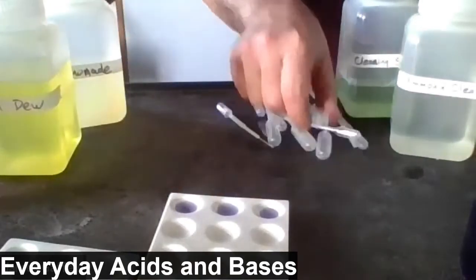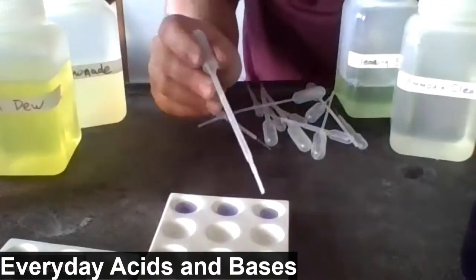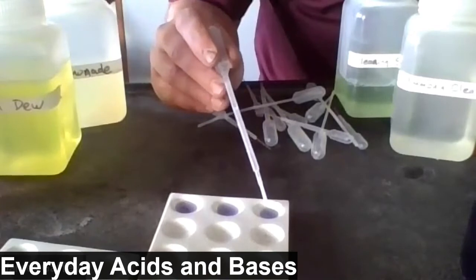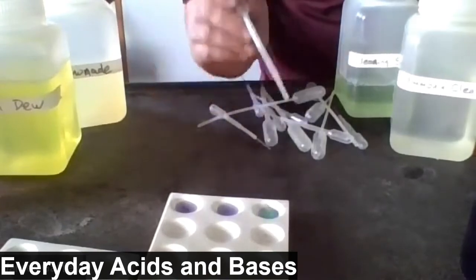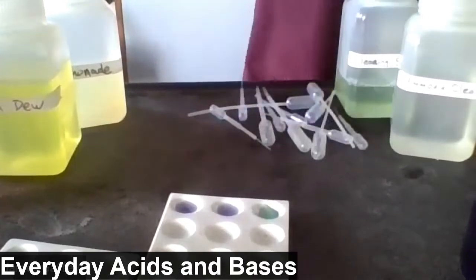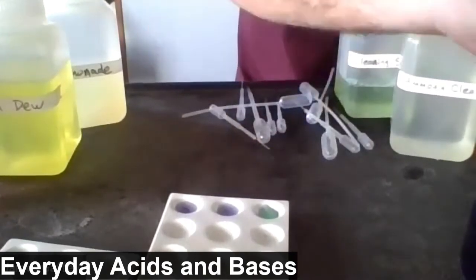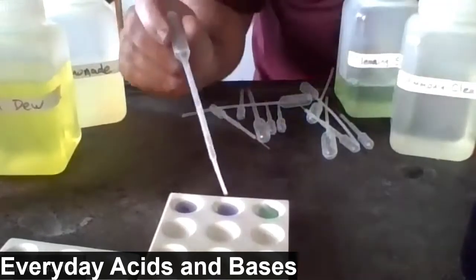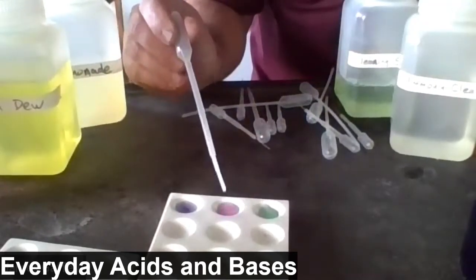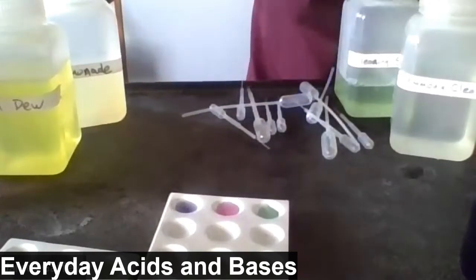Now what I'm going to do is add to this well some base. This is sodium hydroxide. Notice the color change. It's like a bluish greenish color. To the middle well, I'm going to add a known acid. Notice the color change. It's reddish in color now.